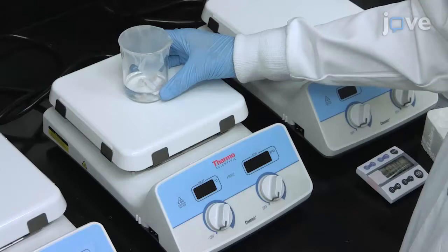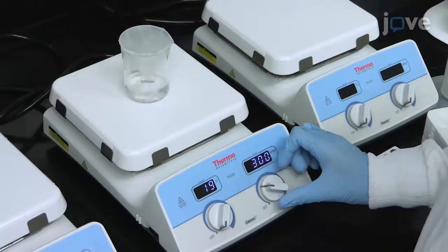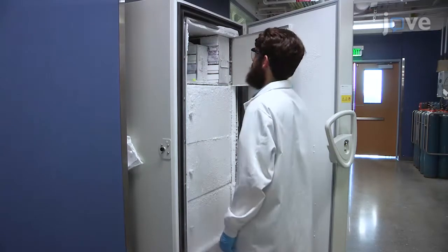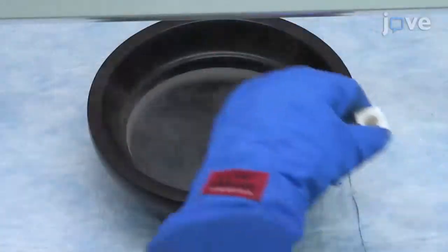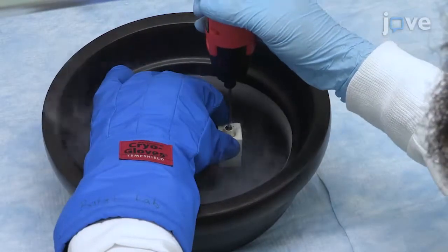ECM composition changes after irradiation, and decellularization can be evaluated using mass spectrometry and Raman spectroscopy. In addition, the fibrous structure of the ECM hydrogels can be analyzed by scanning electron microscopy. This method has the potential to be expanded to examine the effects of radiation on not only tumor cells, but also immune cells, as well as tissues that experience radiation damage as a result of therapy. This decellularization technique will allow researchers to evaluate the extracellular matrix properties of the tissue following radiation, which is an important treatment option in most cancers.